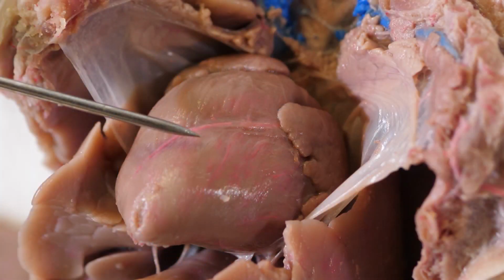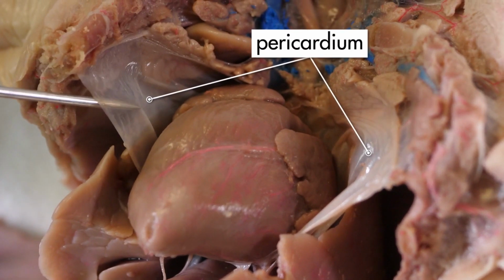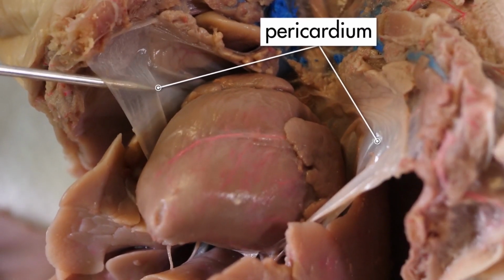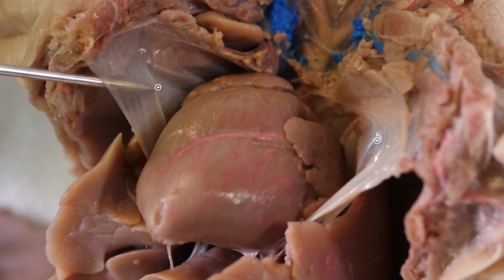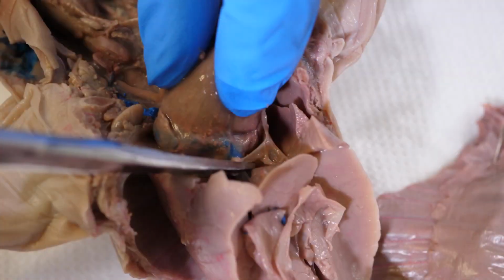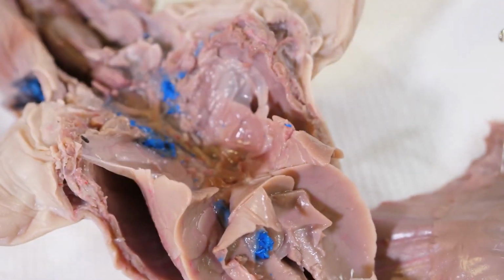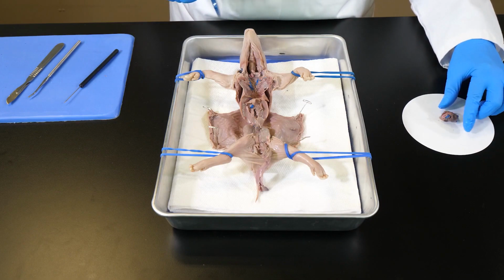The major organ of the pig's circulatory system is its heart, which is located between the 2 lungs. The heart is enclosed in the pericardium, the tough membrane that cushions and protects the heart. We will remove the heart to examine it in more detail. We carefully cut the veins and arteries surrounding the heart. Now we can lift the heart out of the thoracic cavity.